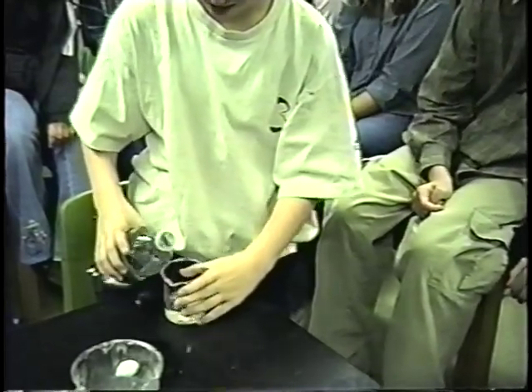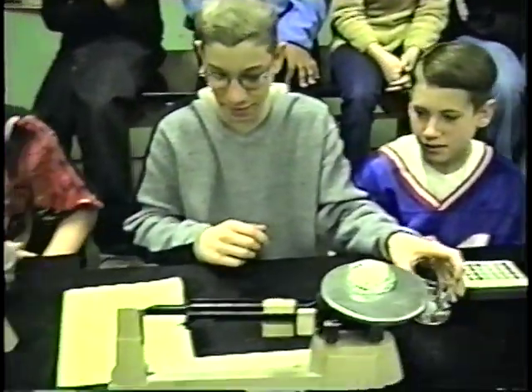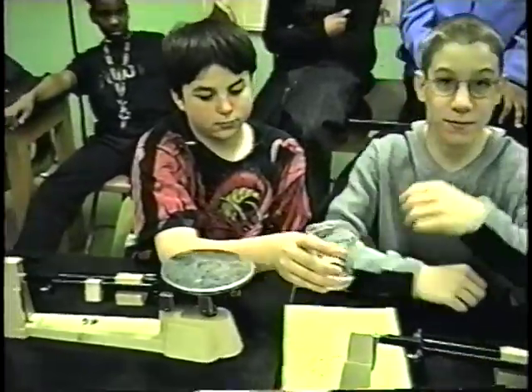Just a little, not a lot. Okay, and if you could weigh that one up as well. So now we're getting the filled container. Originally we got the empty container. And what does your answer come out to? 120.5. And what does your answer come out to? 160.7.